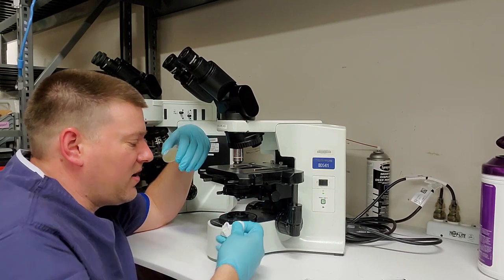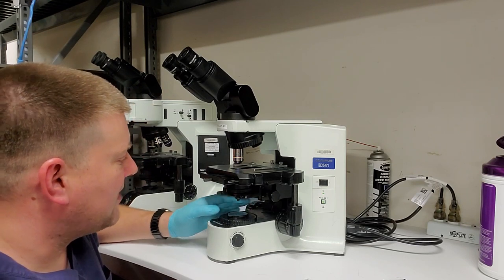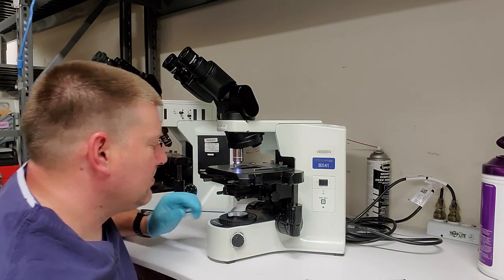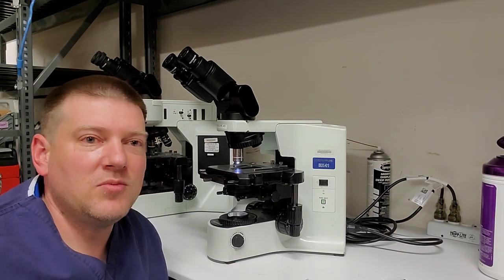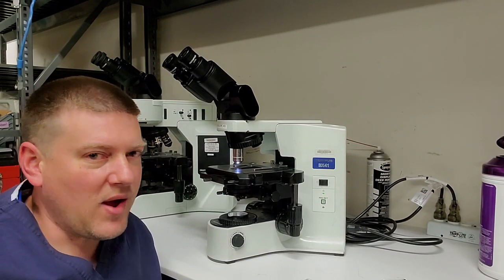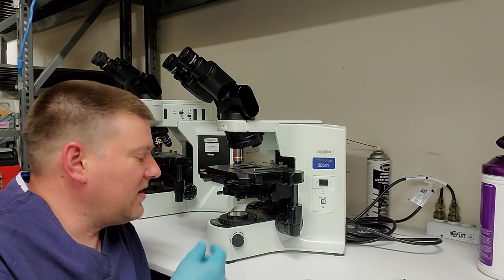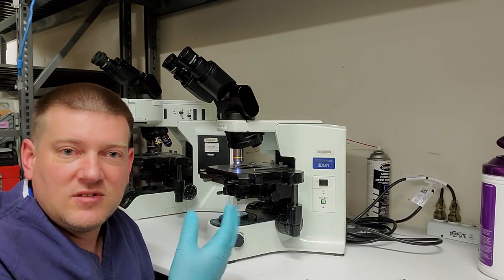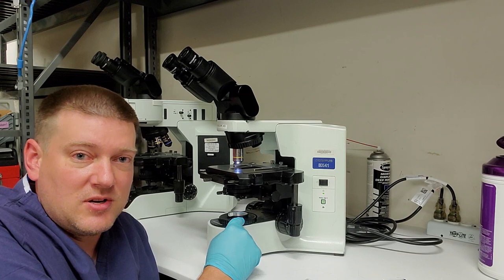There was a big old spot on there of some sort of juice. Right, I'm going to put the filter glass back in, check the iris to make sure it goes throughout its range. And one other thing, guys, when you're working on microscopes, when you're done, make sure that you open the apertures all the way up, just as a habit, because doctors, if they see this right here, they're going to think that their microscope doesn't work, when in fact it's just that the aperture was closed, because some of these doctors never ever touch these apertures.